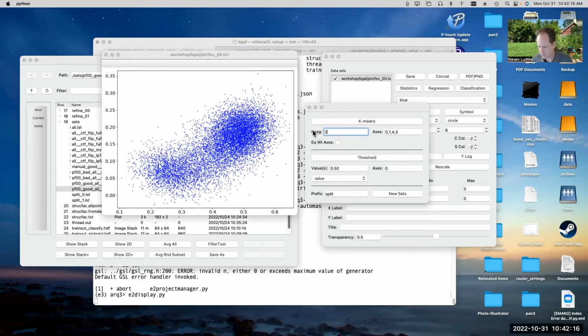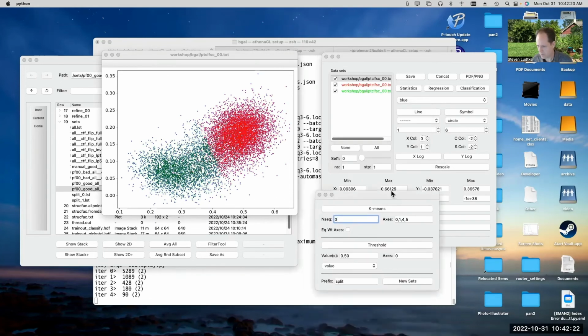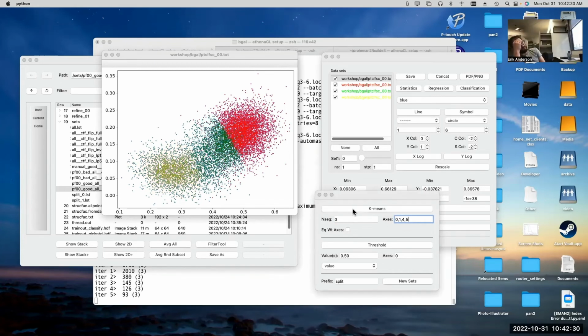Splits it into 3 groups, and then it keeps the 2 groups of the 3 which it knows are the best. Yeah, once again, I only got 2 out. I don't know what's going on with that. It's safe. Why did you choose 0, 1, 4, and 5 for the axes? It worked that time.